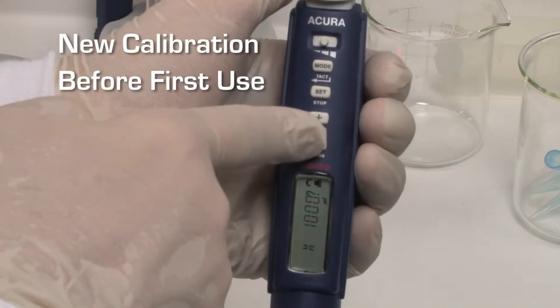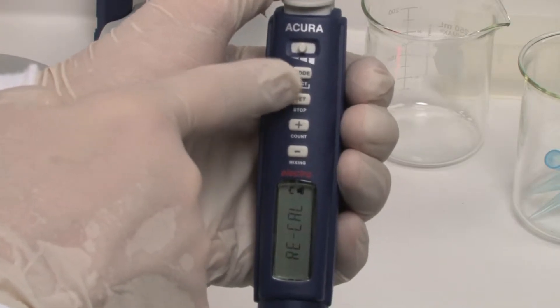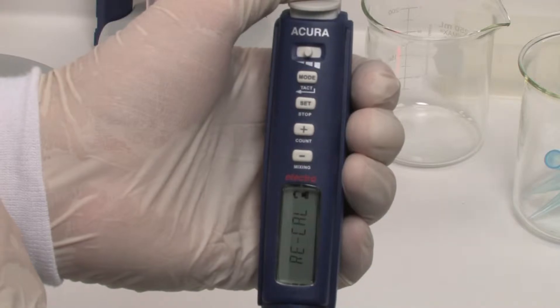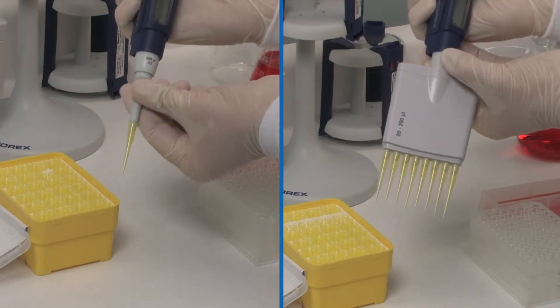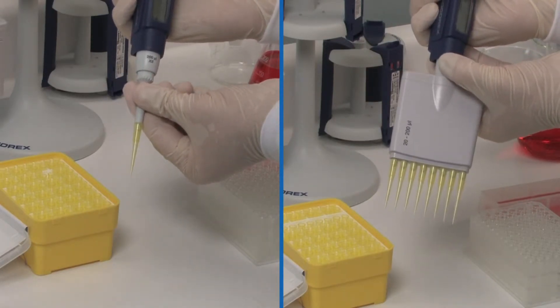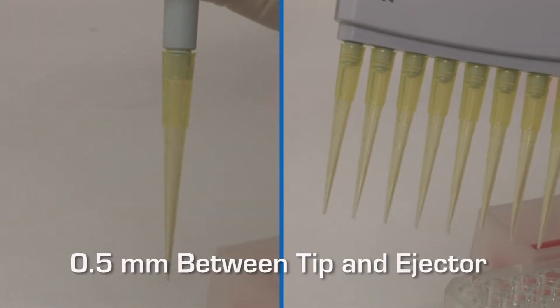Optimal working positions are possible by a 360-degree rotation of the multi-channel volumetric module. A new calibration must be performed before the first use of a new volumetric module. Calibration specificities of extra modules, as set by factory QC or by the pipet owner, are retained in the instrument memory. The shaft height adjustment system called Just-Tip, controlled by efficient click-stops, allows a wide selection of tips to tightly fit the nozzle. Simply turn the ejector until it comes about one-half millimeter from the tip edge.